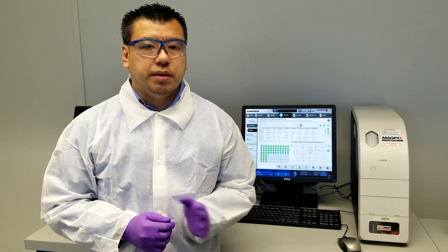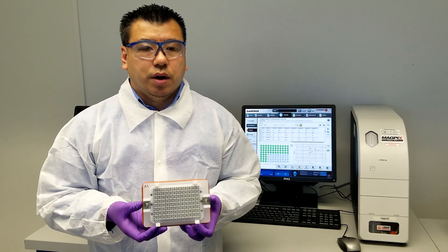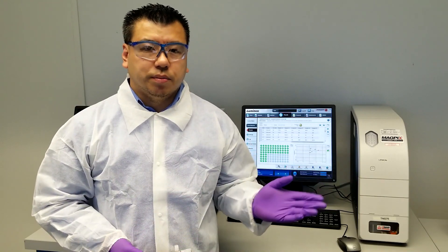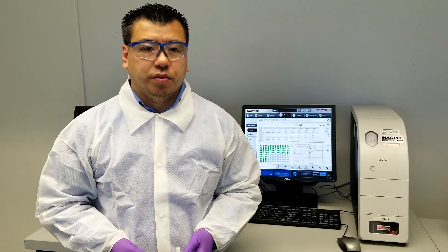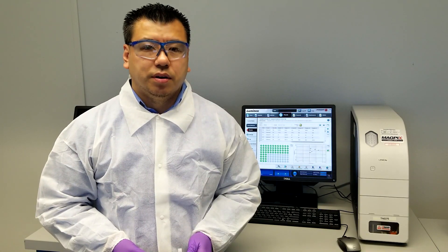At certain points in a typical MillPlex assay workflow, it is important to wash the bead suspensions in the sample wells to minimize nonspecific reagent binding. In the case of magnetic bead assays, this can be effectively and efficiently achieved using a handheld magnetic separator, such as shown here. In this video, I'll describe this device in more detail, I'll go over the other supplies and reagents you'll need to perform a plate wash, and I'll end the video with a demonstration of the wash protocol. Please stay tuned.